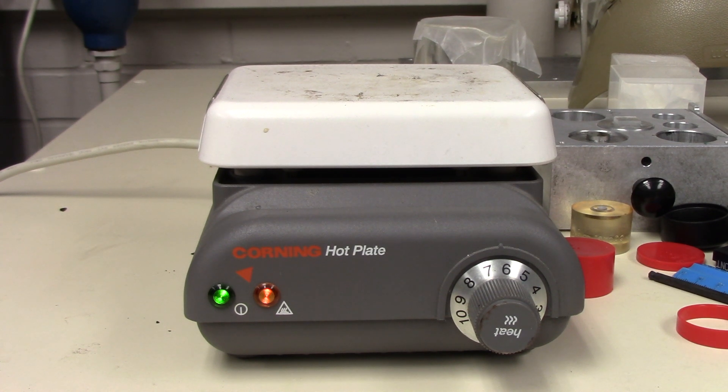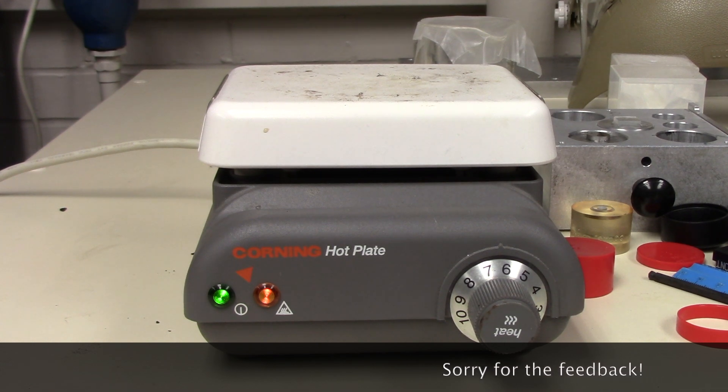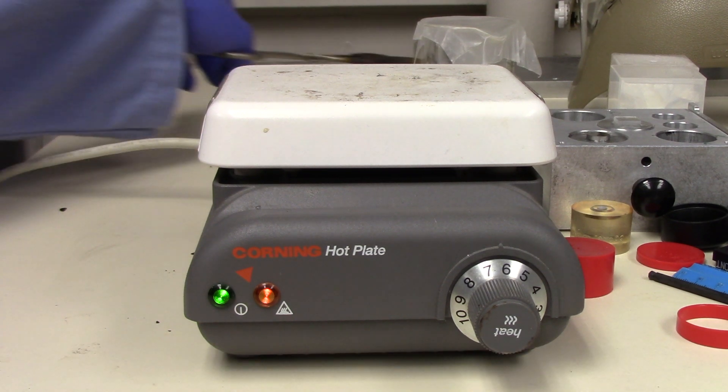And then so for our heat sensitive sample, what we're going to be doing is we're going to be affixing it onto the glass slide off of the hot plate so that there's zero chance of it getting damaged.